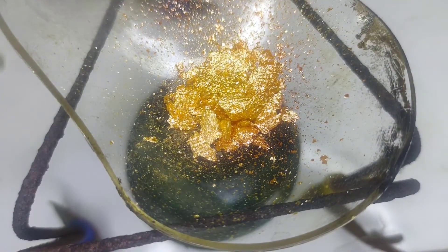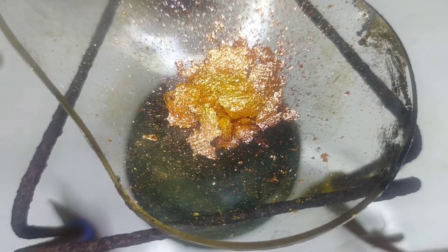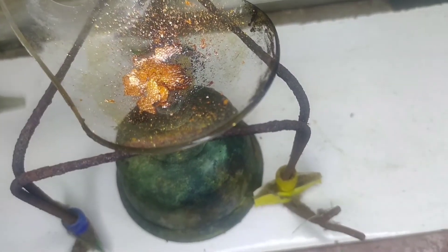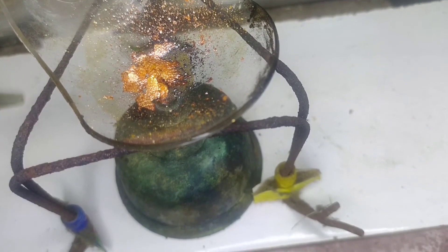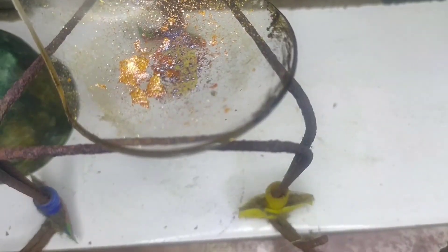On heating, you can see that the color of the crystal changes from yellow to red, and this is called thermochromism. On removing the heat, the color changes back from red to yellow.